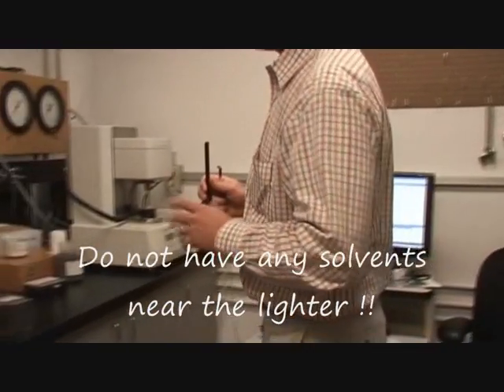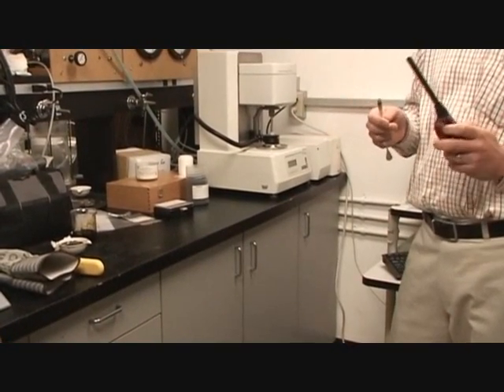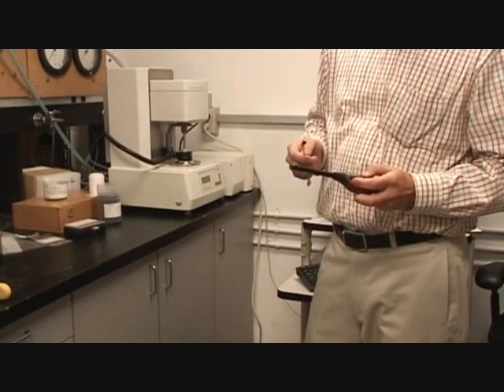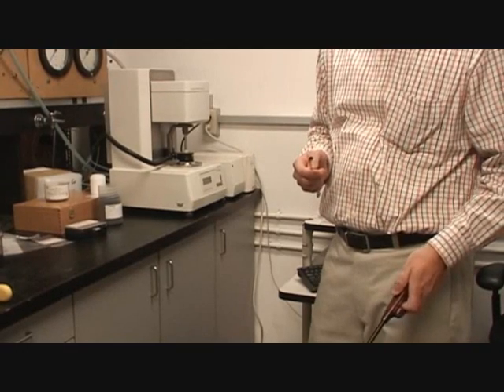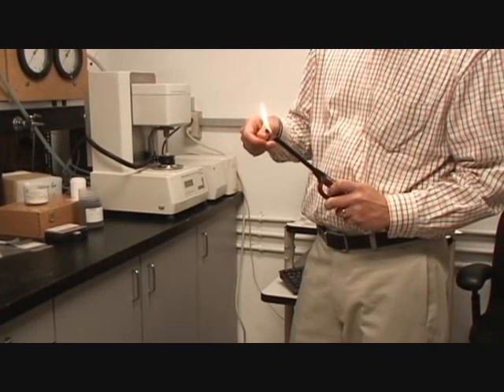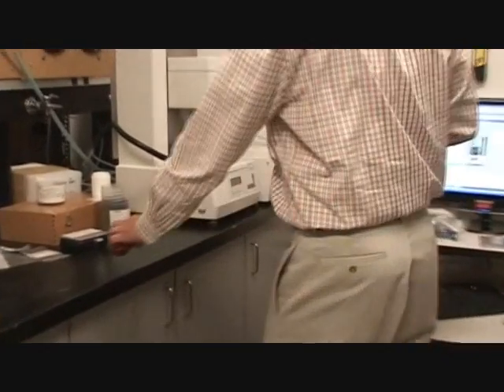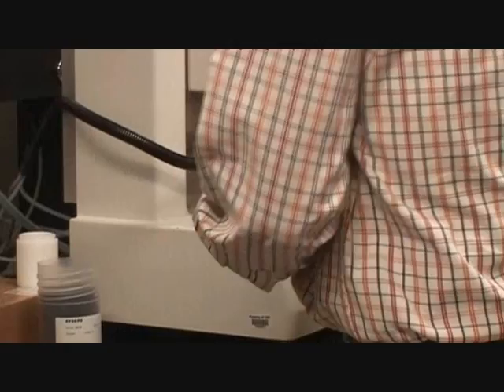Best if you don't have any solvents or anything — you just need something to kind of warm this up. Just warm the end of my blade a little bit. It's not quite all the way pushed through.